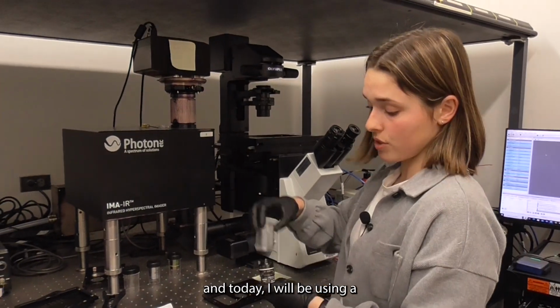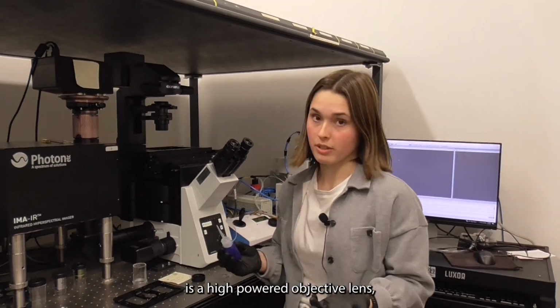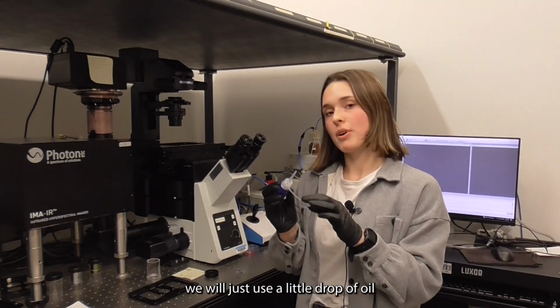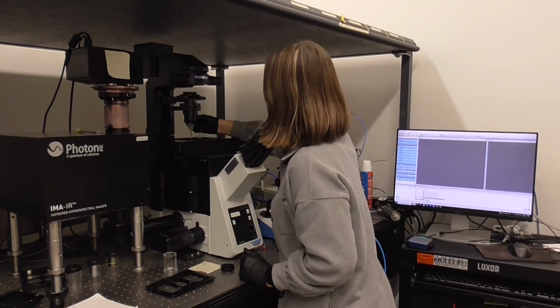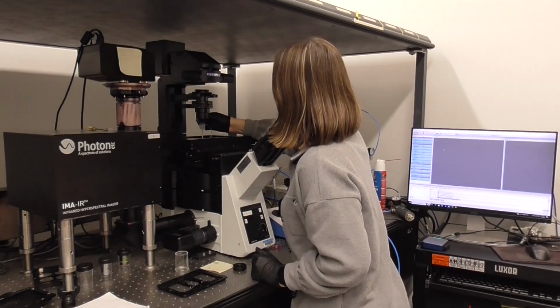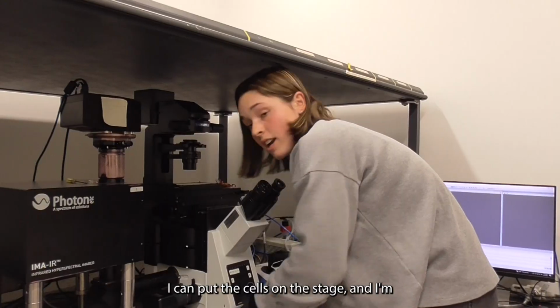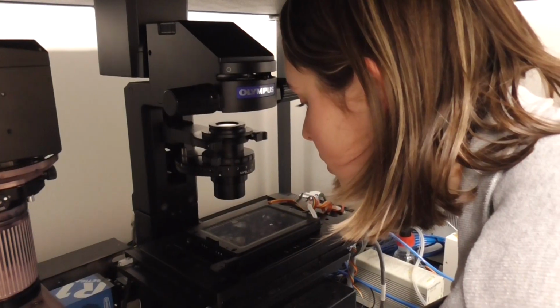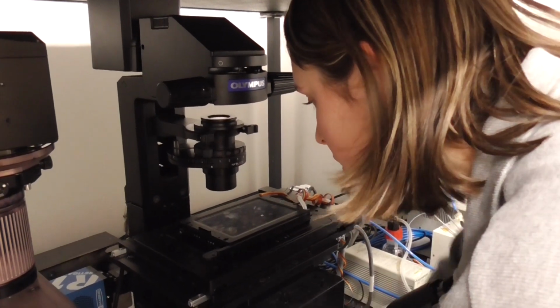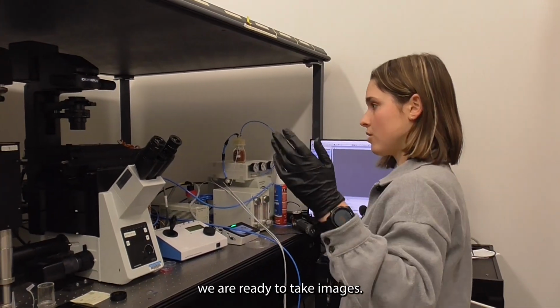And today I will be using a 100x objective lens. Because the 100x objective is a high-powered objective lens, we will just use a little drop of oil on the top in order to get that image that we need. With that all set up, I can put the cells on the stage. And I'm going to position the stage so that it's right over our objective lens. Now that everything's all set up, we are ready to take images.